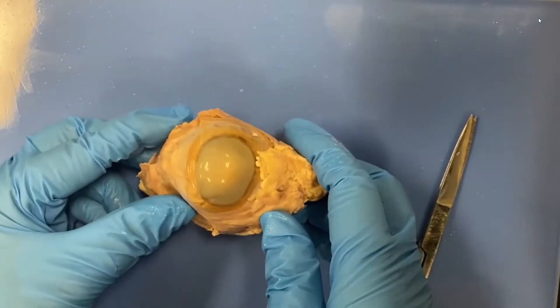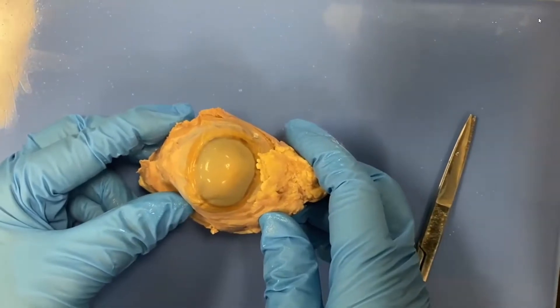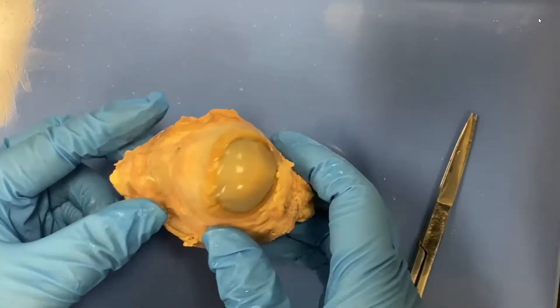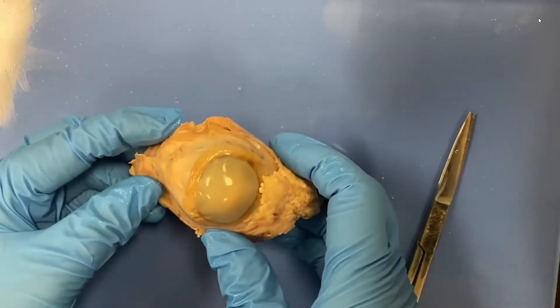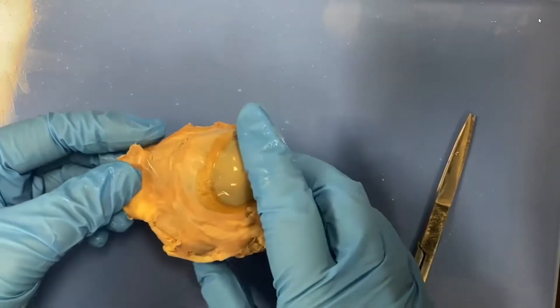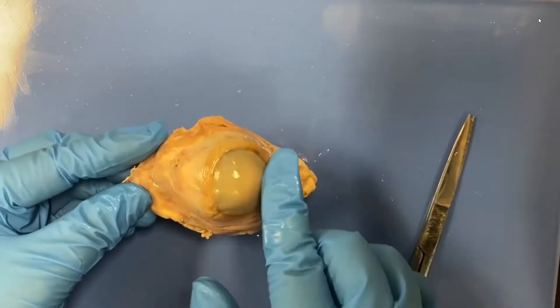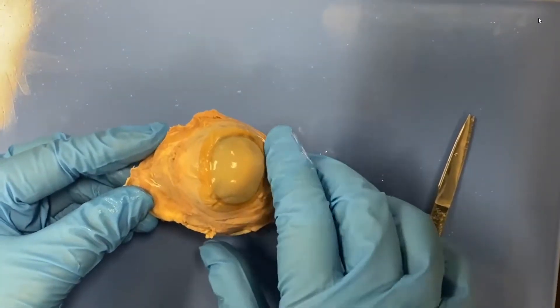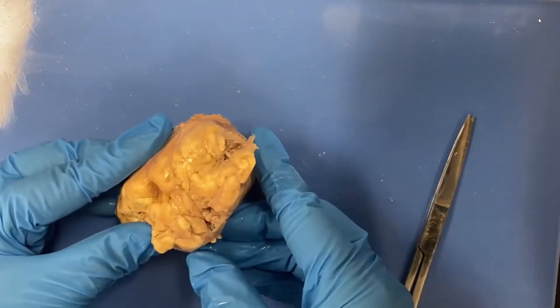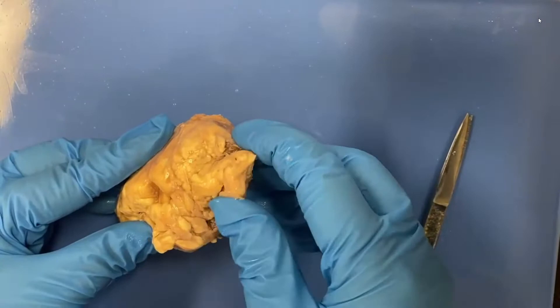Now the cornea should be clear, and it's not. So can you think of a reason why it's not clear? We'll get back to that. So if this is the anterior portion, that means back over here is the posterior portion.